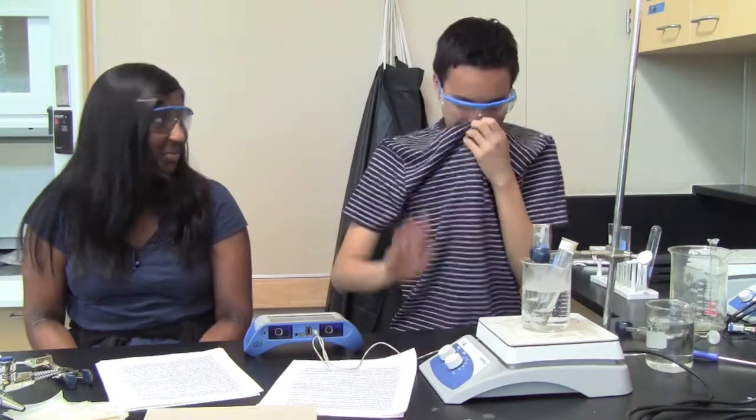Now we'll be starting part 2 of the lab, which is determining the freezing point of a solution of benzoic acid and lauric acid. Since benzoic acid would not work in this lab, Mr. Zunas gave us solid citric acid. Citric acid, not nitric acid.